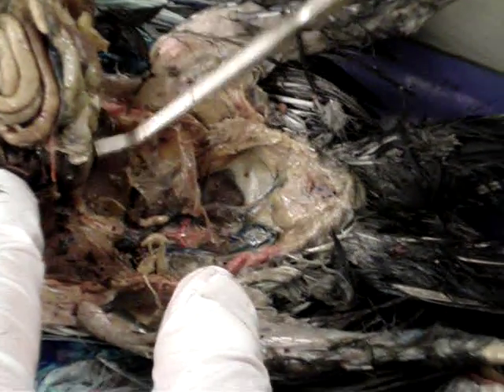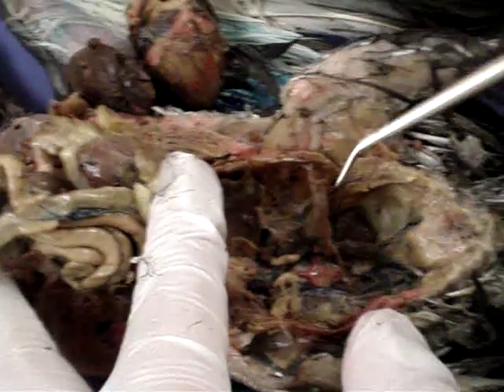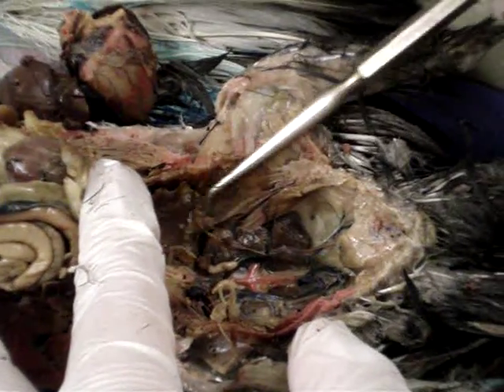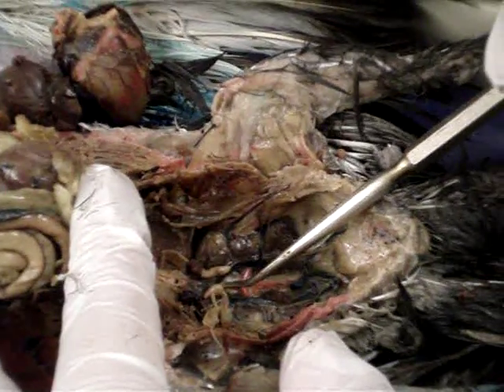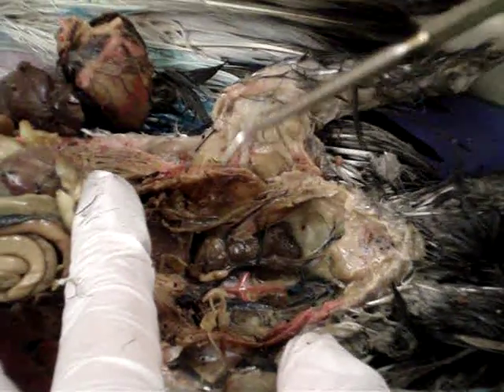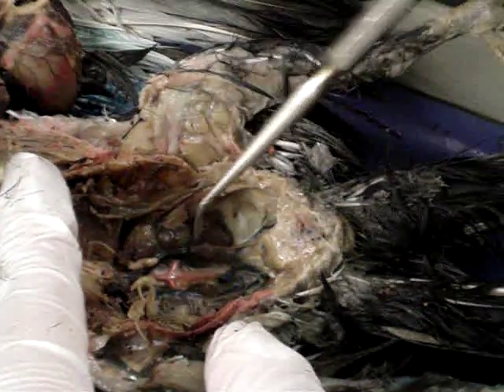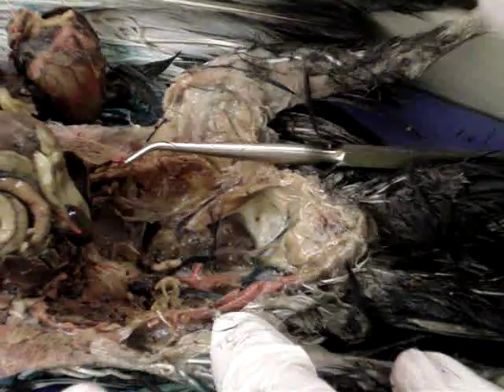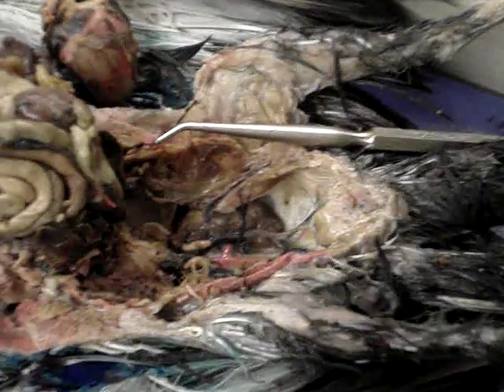This pigeon is a boy, so it has testes, and the testes are here — the light-colored objects, left and right, two testes. In the female pigeon, you only have one set of ovaries.